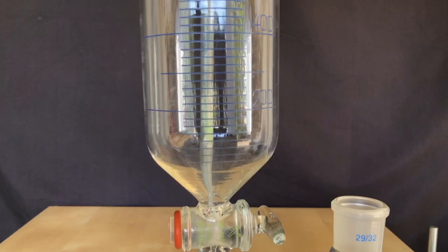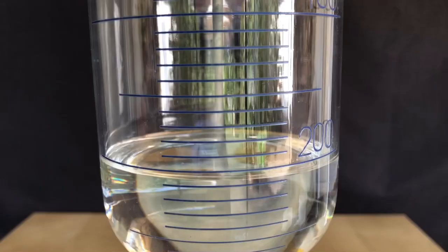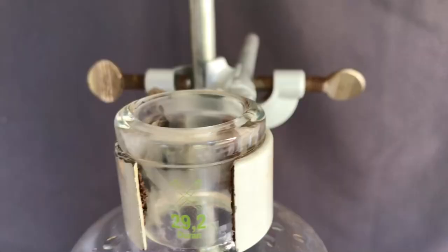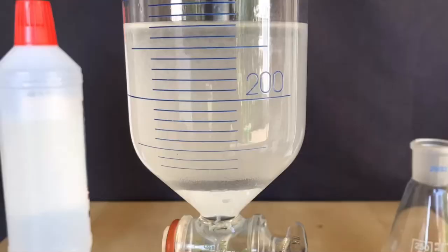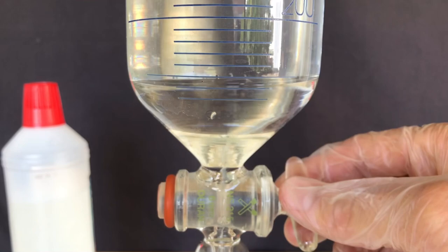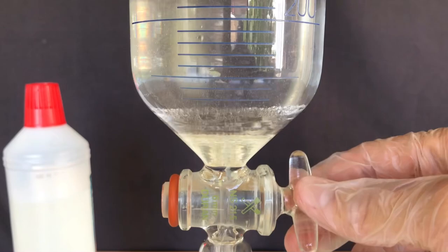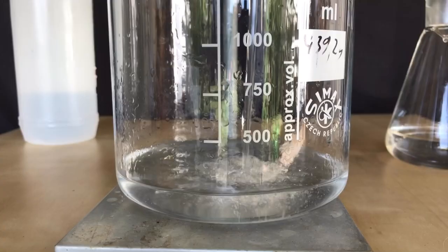Before attempting to purify it using distillation, which would lead to a contaminated product, we will get rid of as many contaminants as possible beforehand. The ethyl ester was chosen because it is less soluble in water than the methyl ester. One water wash using 200ml of ice cold distilled water and one using 100ml were performed. The layer containing ethyl chloroacetate was the bottom one. The majority of contaminants simply dissolved in the water, and the wastewater in the top layer was collected for proper disposal.